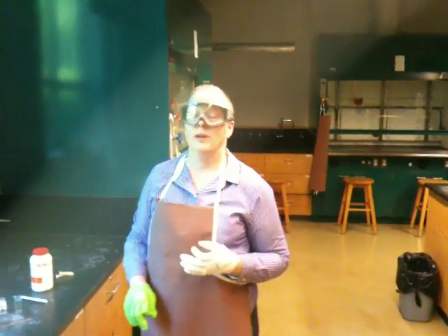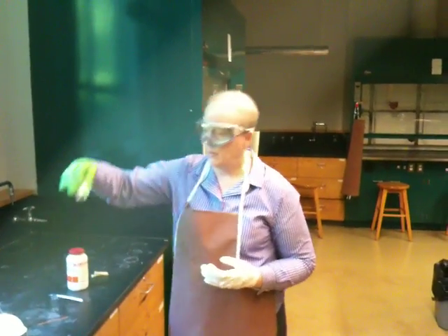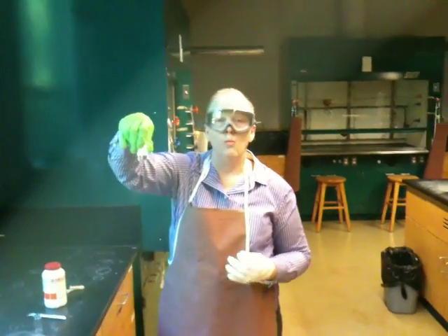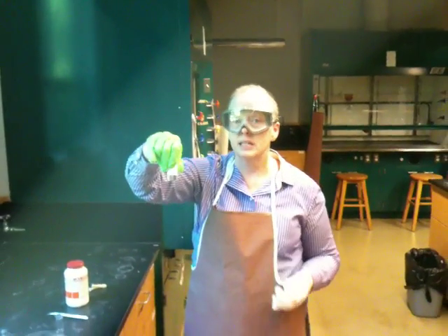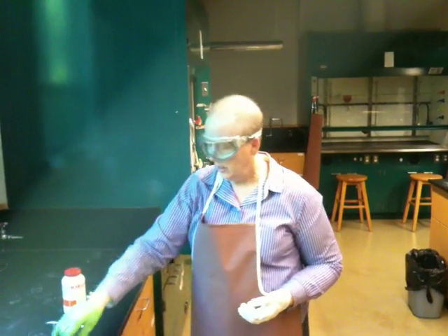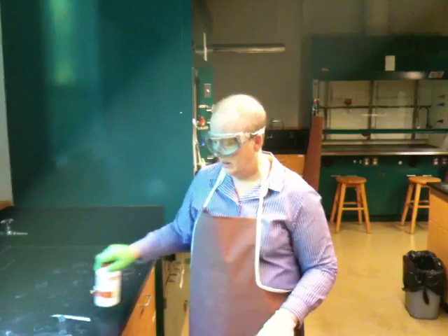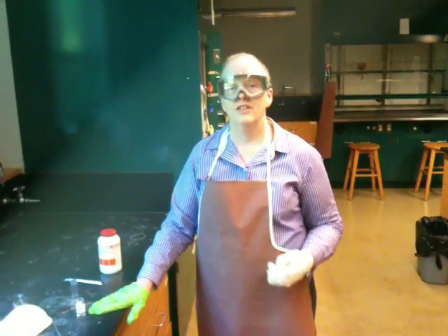Today I'm going to show you how to make a micro drying cartridge. That's what we call it. Frequently when you have an organic liquid, the liquid will be wet. And what that means is not that it's a liquid, it means it has some water in it. And typically what you do is you take a drying agent like sodium sulfate and put it in the bottom of the sample and then decant or filter the sample out.